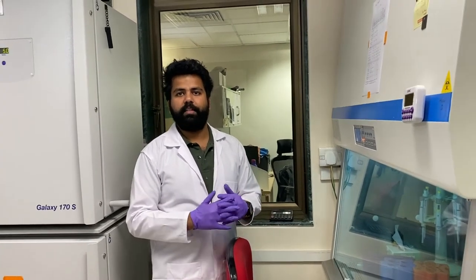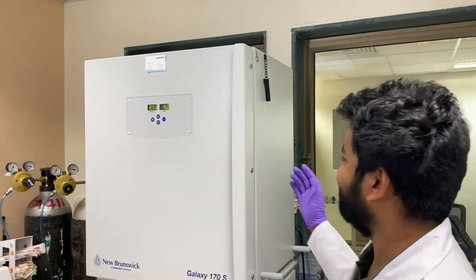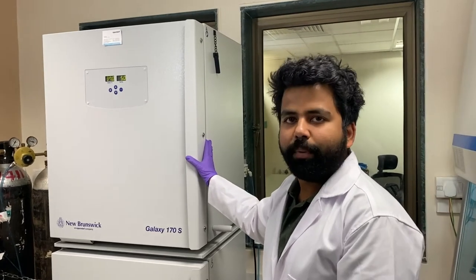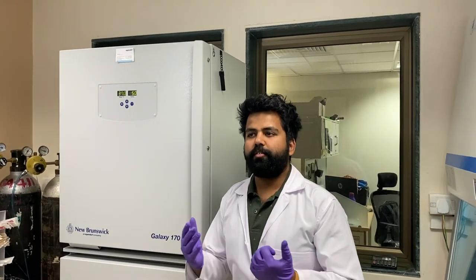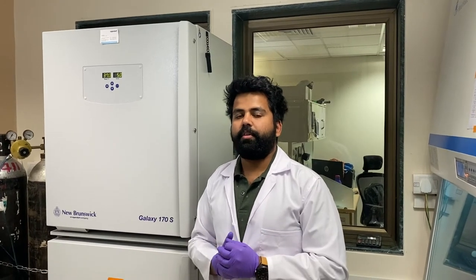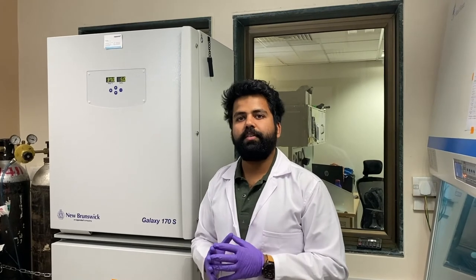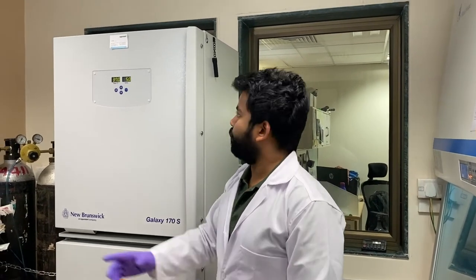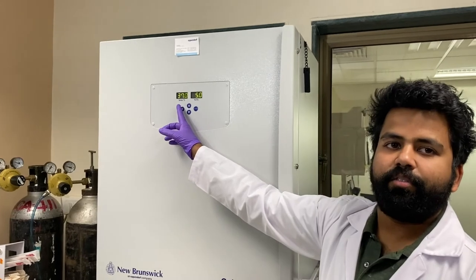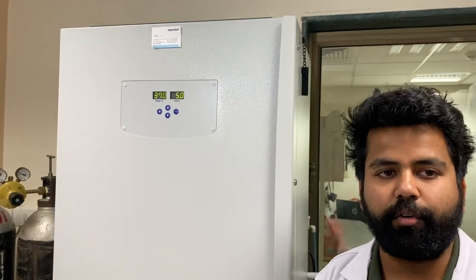To clean our benches, hands, and surfaces, we disinfect with 70 percent ethanol. These large units are not refrigerators — they are incubators. They provide cells with the environment needed to grow and flourish. The most important condition is temperature, which is maintained at 37 degrees Celsius, the optimum temperature for cell growth.